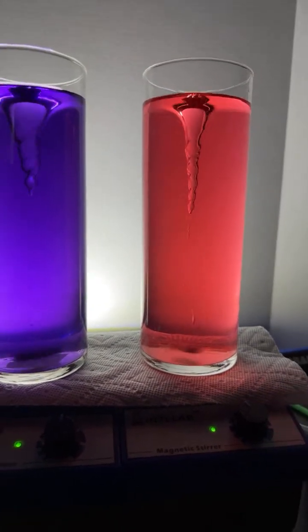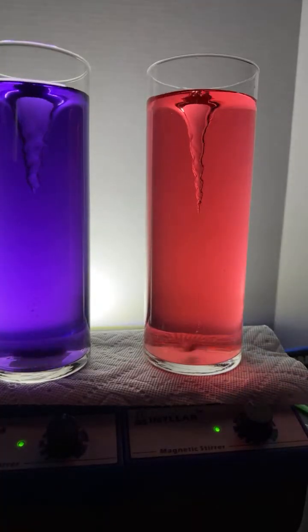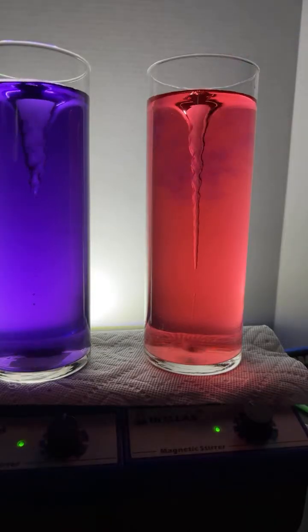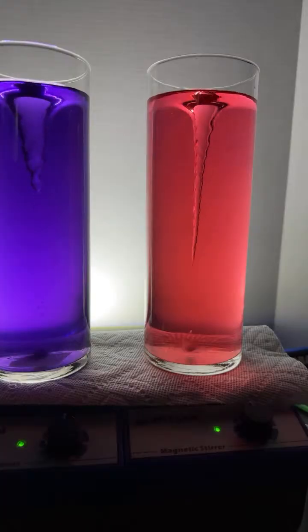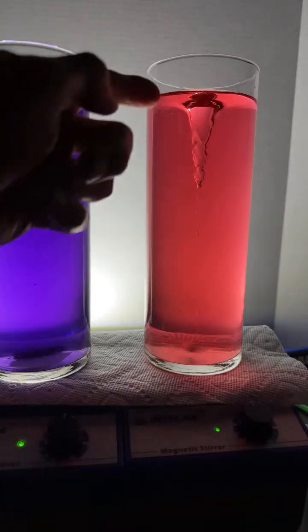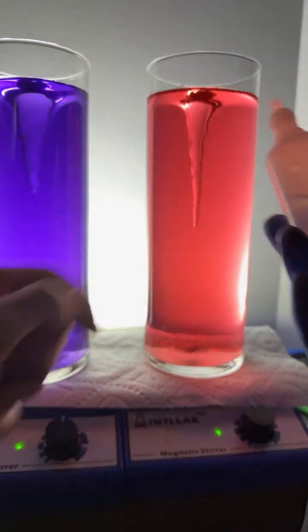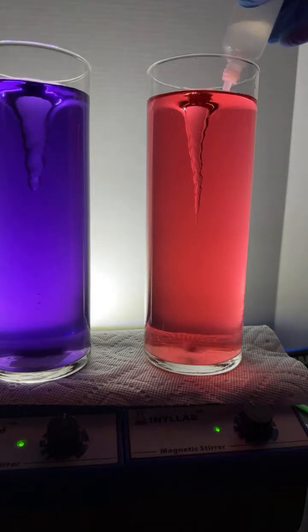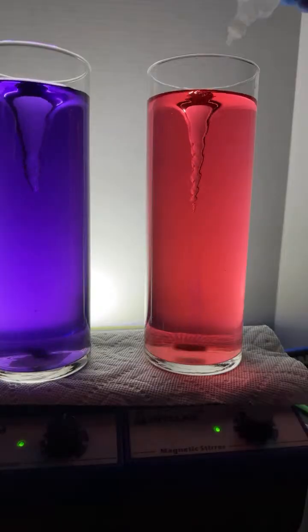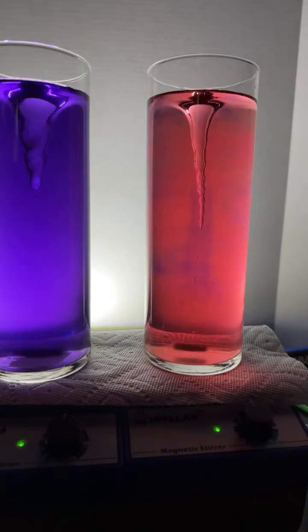Okay, then what you do is you find the mass of this. And then you start to add drops. I'm going to add a drop here. And you can do measurements by volume, or you can do measurements by mass, either way. And then let's just say we're going to carefully measure the mass of this that we added. I already added a drop. Let's add another drop. So there's a second drop, and each drop has a certain mass to it. And I'm just going to continue doing this until the acid is neutralized.